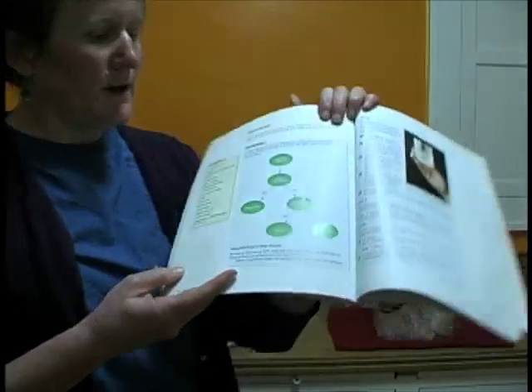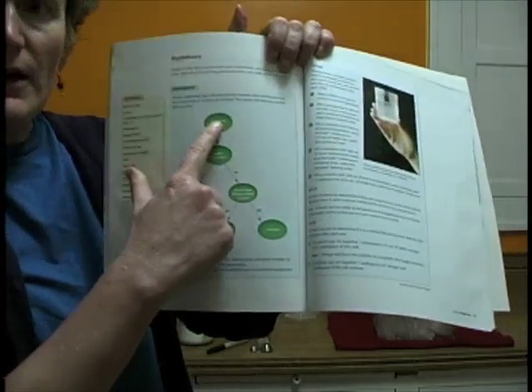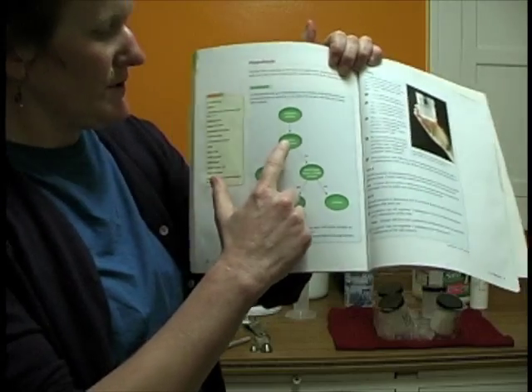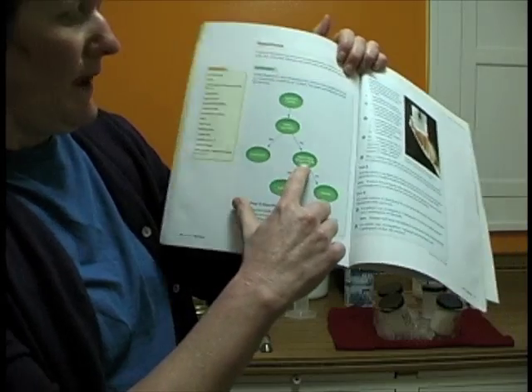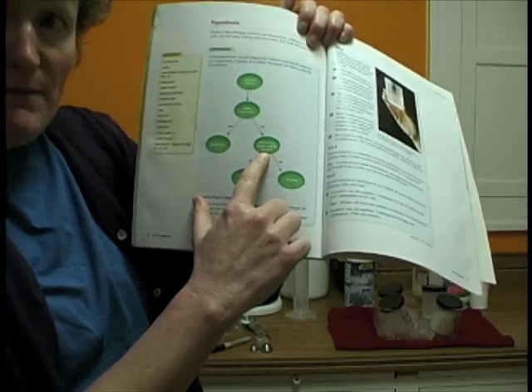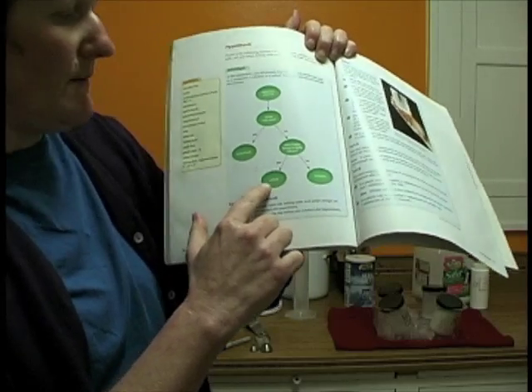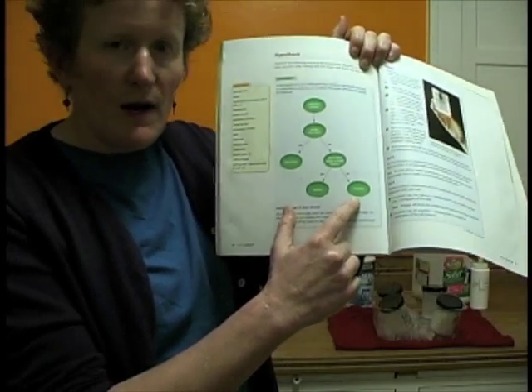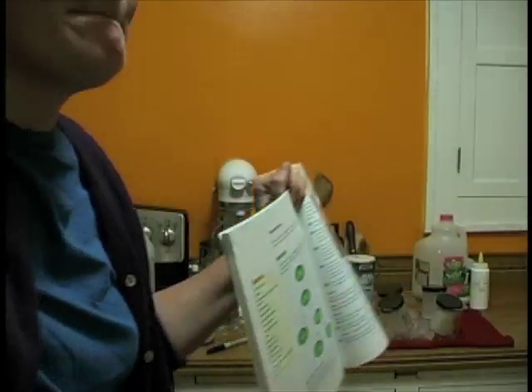In part C, we're going to continue to work on this chart, which is on page 70 in your lab book. We've got a lot of unknown solutions. We check to see if they settle over time. That means a suspension. And we check to see if it got lumpy or fluffy masses when we added vinegar. If that was yes, that was a colloid. If it was no, it's a solution. Now we're going to work on checking to make sure which ones are solutions.